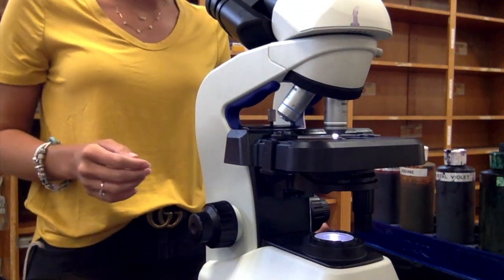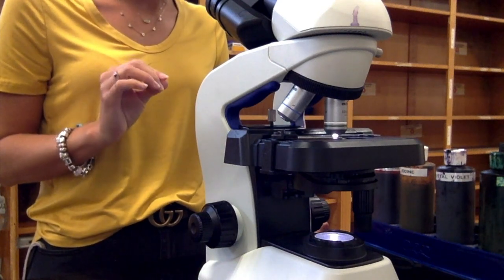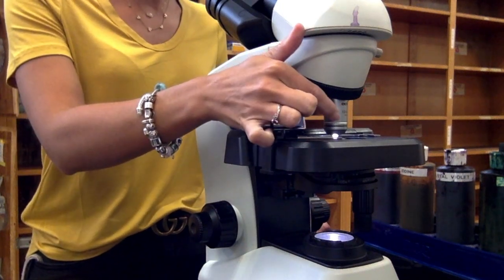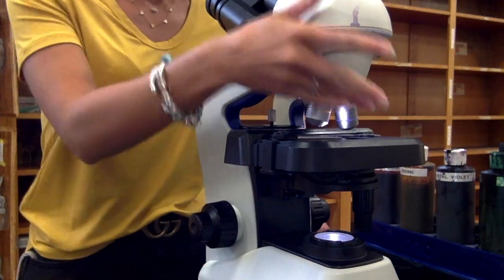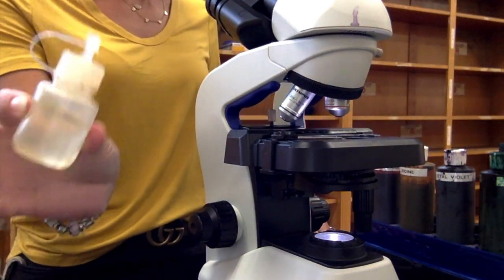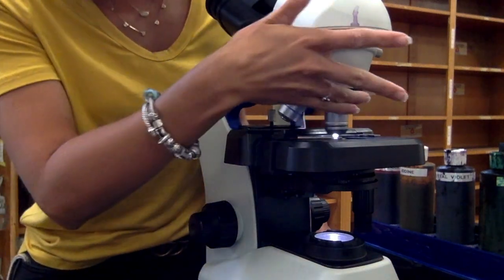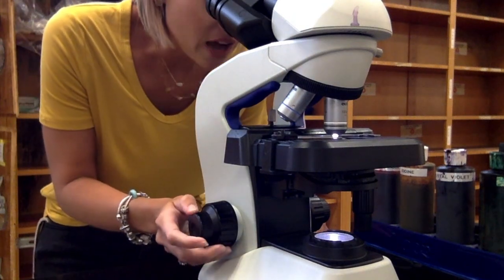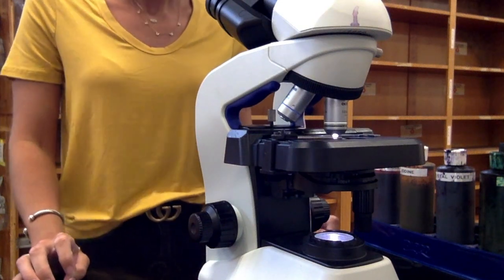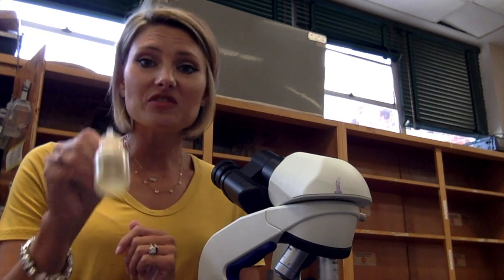Then move on to the 100x objective lens. Remember, this is an oil immersion lens, which means you have to add immersion oil to the slide before you can get anything focused. If you had a slide on the stage, you would take your immersion oil and put a dot right where the light is coming over the slide, directly on your smear. Then move back to the 100x objective lens and touch the fine to get it into sharp focus. You have to use oil on the oil immersion lens to get that really good resolving power — that 0.2 micrometers of resolving power that we talked about earlier.